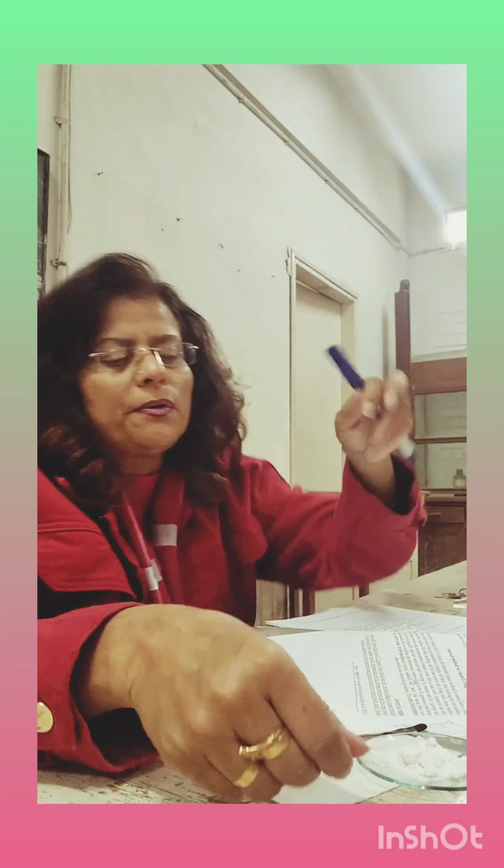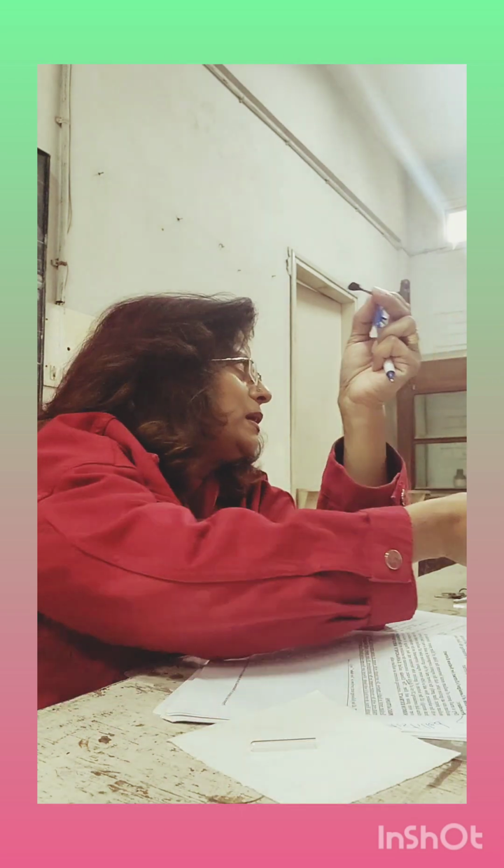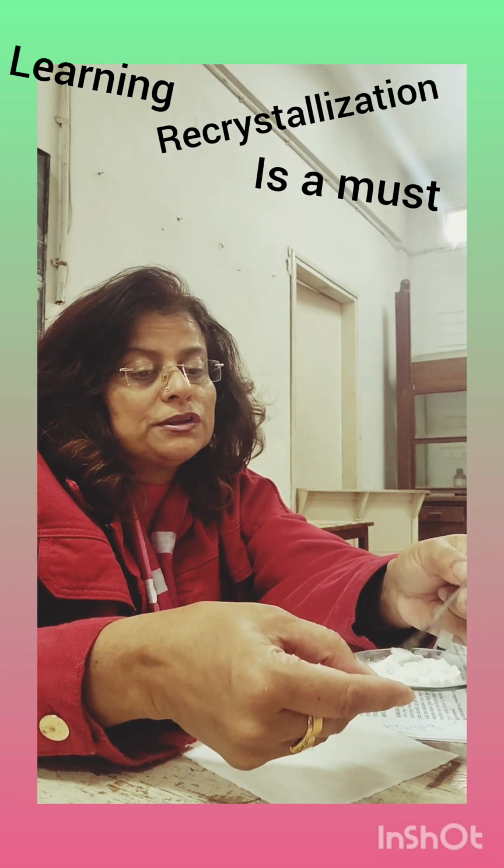Now you know that this is your organic compound, right? This is your organic compound. You can see the shiny crystals. It's shiny. You see acetanilide, it's shiny, right? I will also make you learn how to do the recrystallization of acetanilide. I hope you have done it in your part 2. I don't know if you have done it or not, but it is in your course. Anyway, so this is acetanilide.